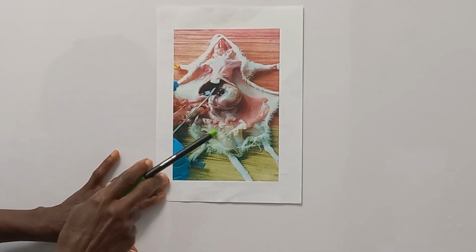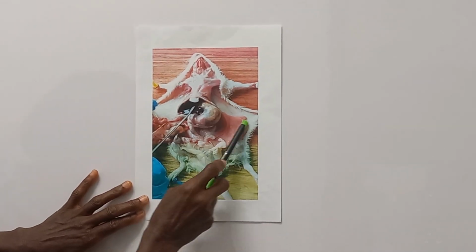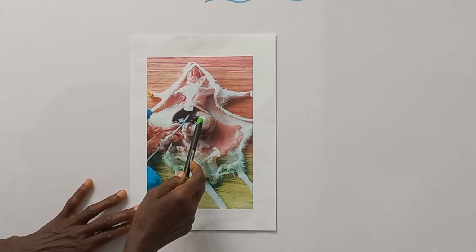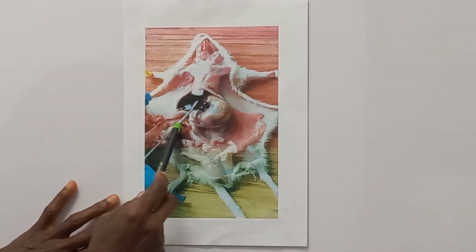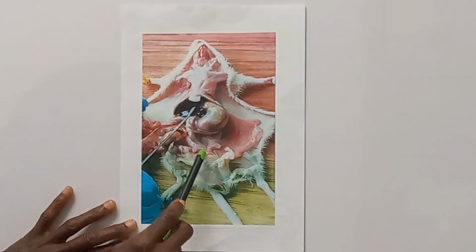Here we have an albino rat. We have the ventral body wall. Here it is removed. Look at this space. That is the body cavity in which we have the digestive system, the stomach, etc., here. And then we have part of the reproductive system.